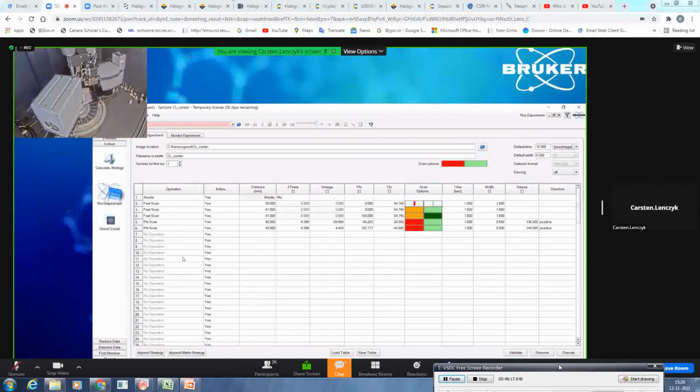So fast scan is basically a substitute for the matrix runs. With previous detectors and generations of diffractometers, most of the time you would use matrix scans because you would save time, and you would do, for example, 20 or 10 degree scans in 3 different positions of the goniometer. So you will get 3 different positions of the Ewald sphere, and out of that information, you most of the time can determine at least the unit cell. And then you could cross-check with the databases if this was known.